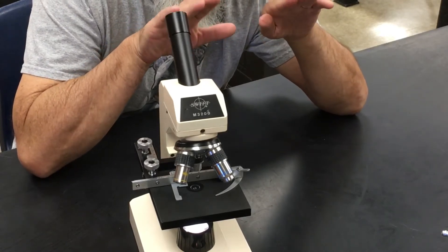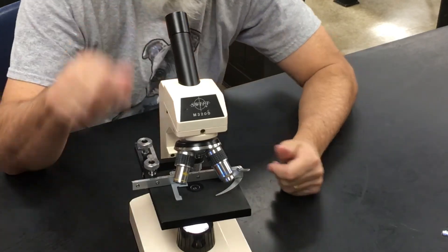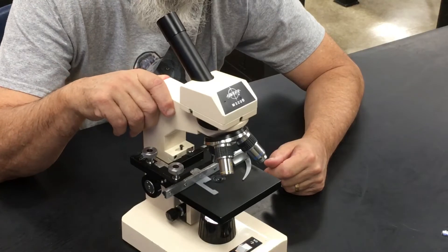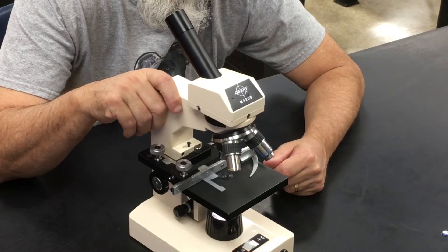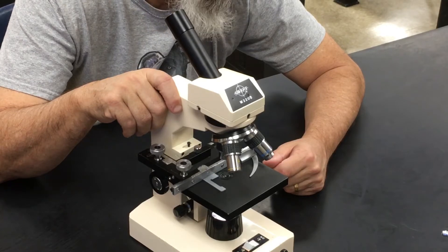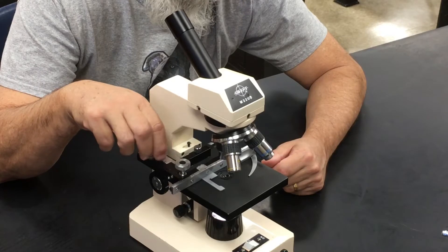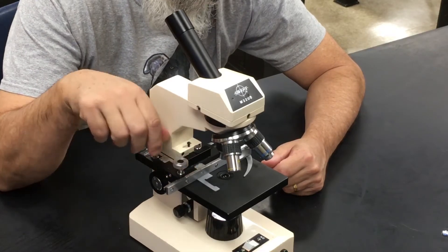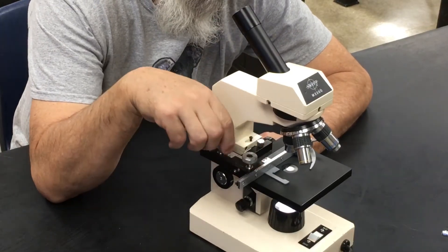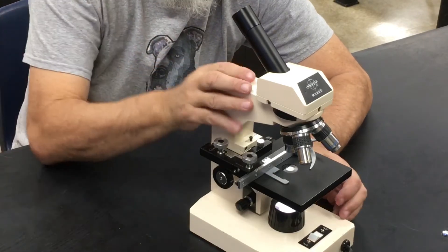This system is a little more accurate. The way you move things back and forth or up and down is with these two little chrome knobs — these are called the stage control knobs.